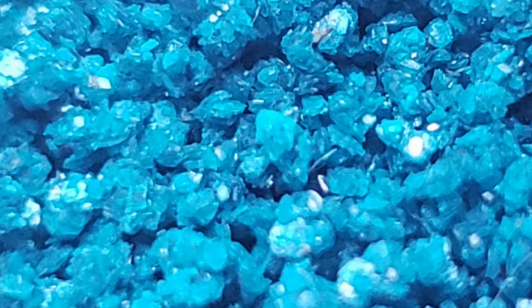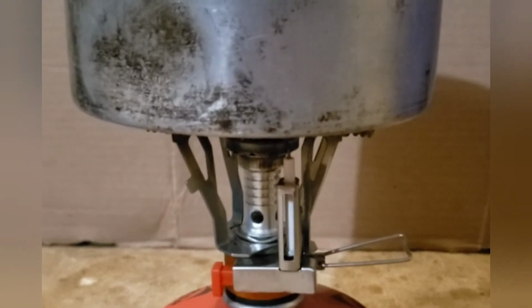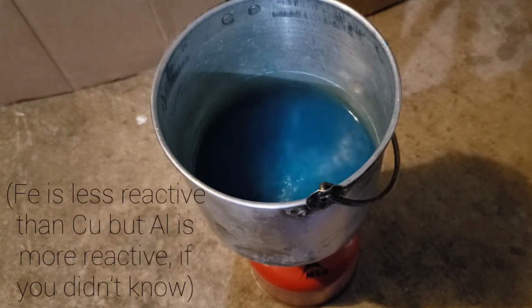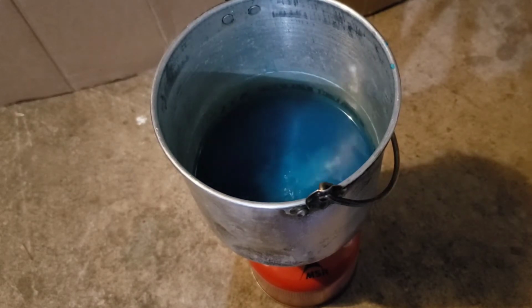But anyway, I really didn't feel satisfied with that, so I decided to just try it again, but this time use a metal pot, logically, so it wouldn't break. And this is a different kind of me being a dumbass, not considering what kind of metal the pot was made of. Certain types of metal, like if it was made of steel, for example, would have been fine. But this pot that I used was an old pot from a camping mess kit, and therefore was made to be really light, and therefore was made of aluminum, which of course reacted with the copper acetate, and produced aluminum acetate and copper metal.